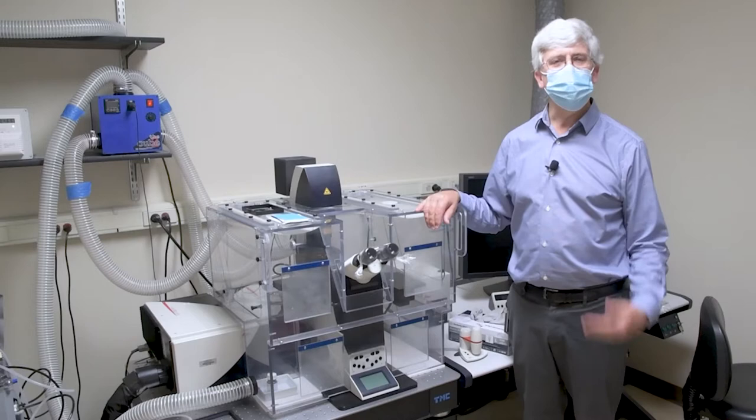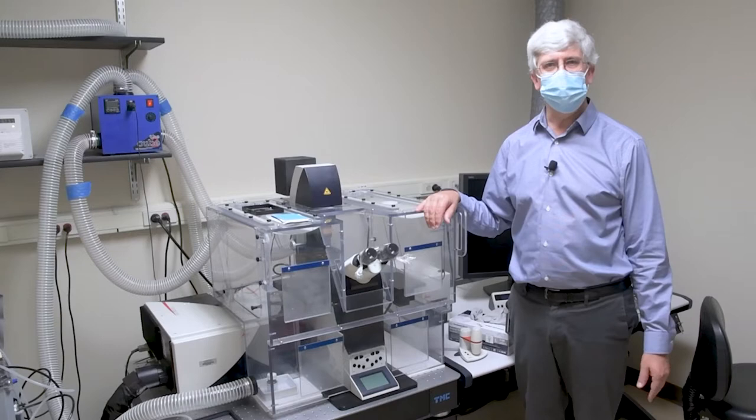Hello, welcome to the Wistar Institute Imaging Core Facility. My name is Jamie Hayden and in this video we're going to be taking a look at the Leica SP5 Laser Scanning Confocal Microscope.